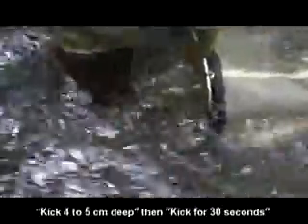You want to try and get down about 4 to 5 centimeters deep, and you're going to kick for about 30 seconds. You're going to time that on your watch or your stopwatch. Okay, so 30 seconds is up, and I'm going to pull this up. And this is what you come out with.